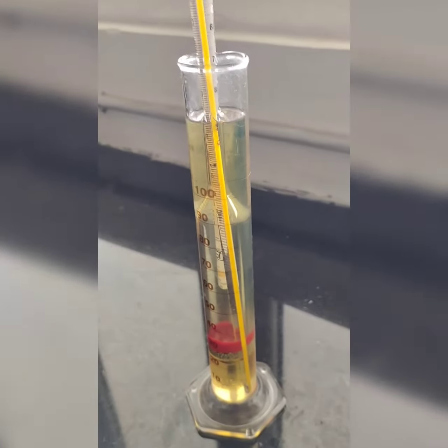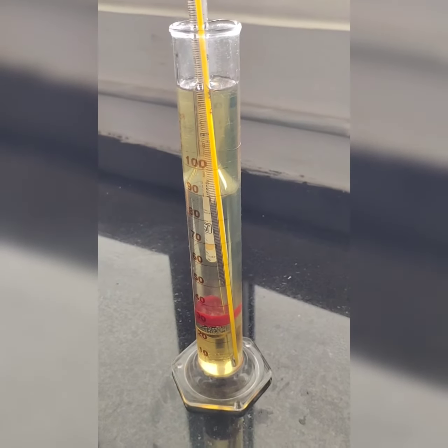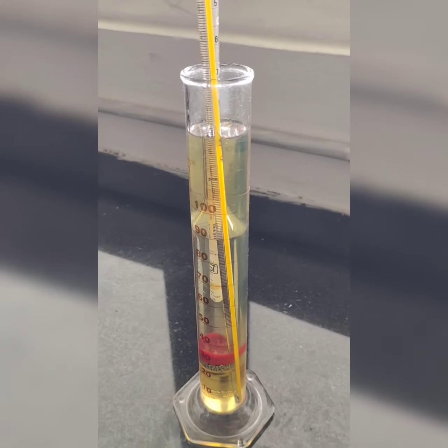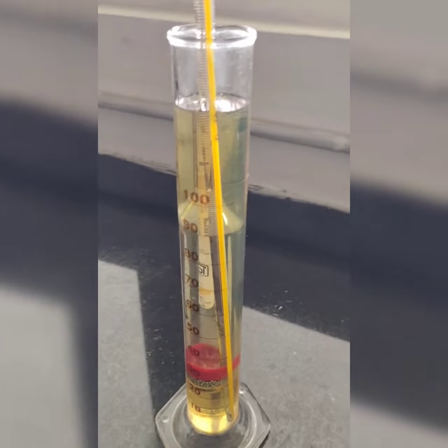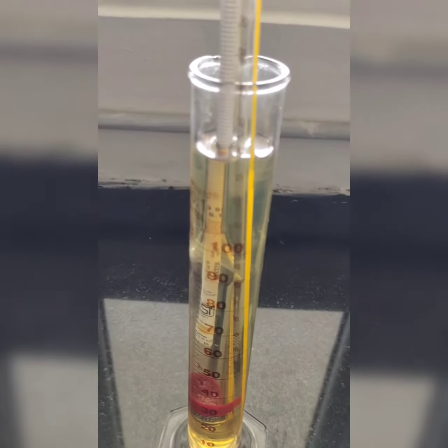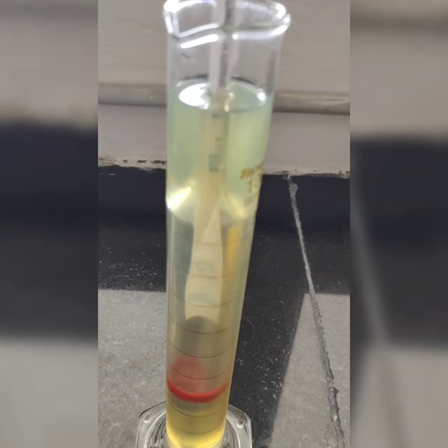What is the kerosene color? It is colorless basically. If it is PDS kerosene, then the blue color will be added, but it is neither blue nor colorless, it is yellowish. That means it is adulterated. 0.791 it is there.